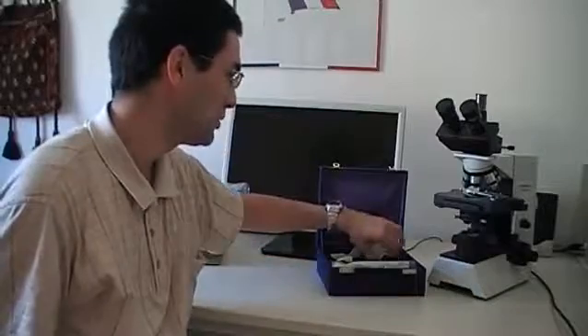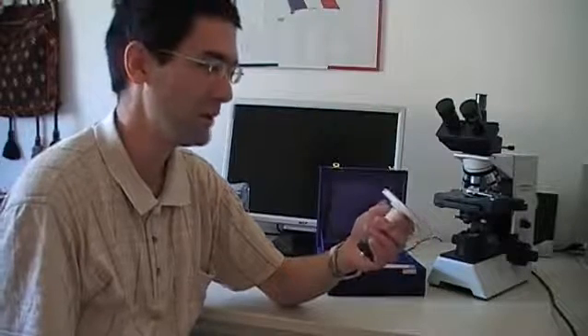Hi, I'm Oliver Kim from the website microbehunter.com. Today I'd like to try out a new hand microtome which I bought myself a few days ago. I have not used it a lot, so it's going to be one of the first tries for myself. I'm going to try to cut a few carrots with a microtome, and then we're going to have a look at the results. Let's get started.